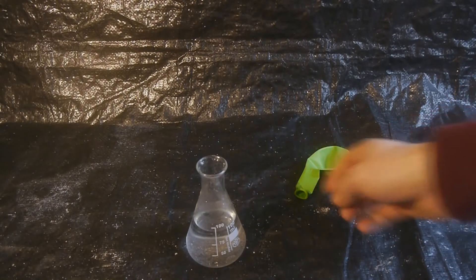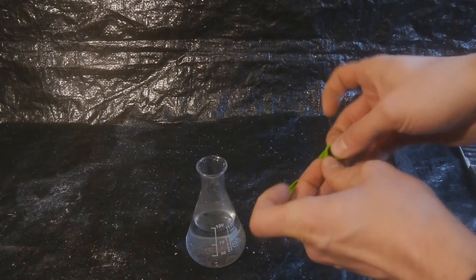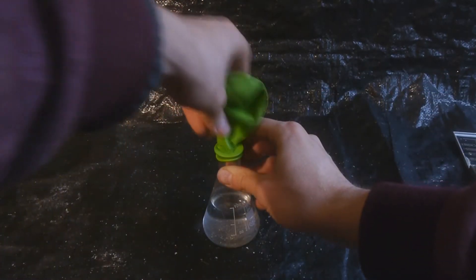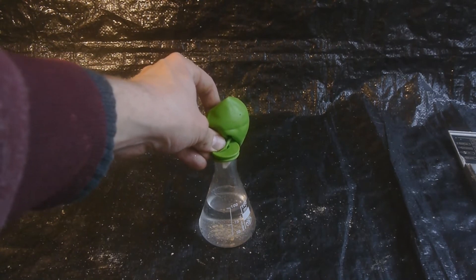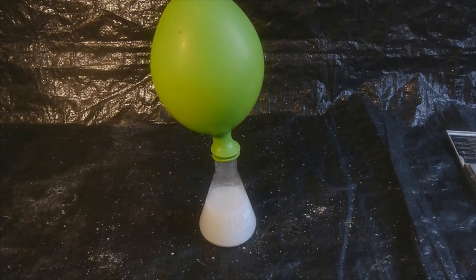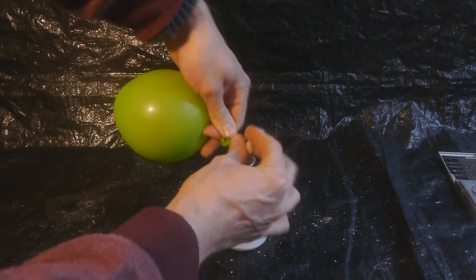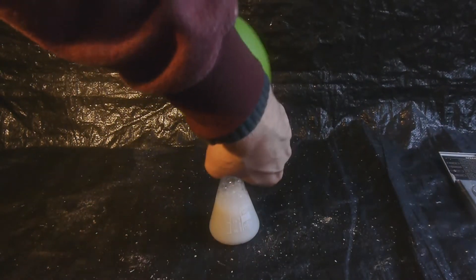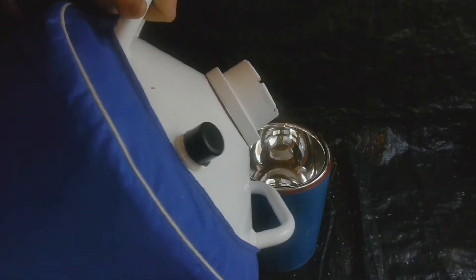In order to freeze it, we're going to start by filling a balloon. I've got here a roughly 3.3 gram piece of carbide and I'm going to put it in the balloon, which I'll then place over top of this Erlenmeyer flask, and let the carbide drop into the water. That might not be the best idea since it'll get mixed with some oxygen, but no risk no fun. Let's add another piece with about the same weight — that balloon is an okay size now. Let's get some liquid air ready.